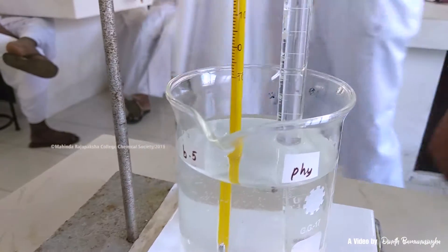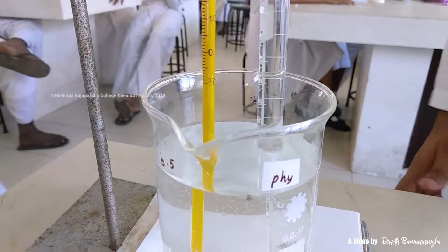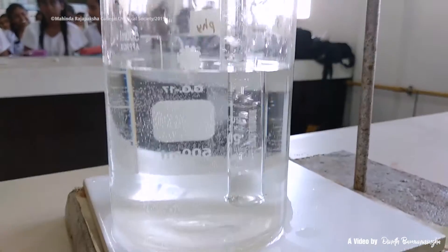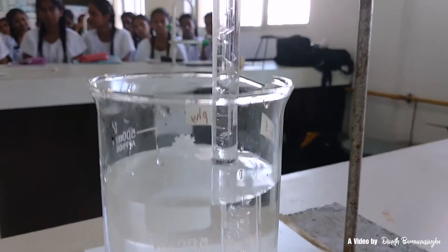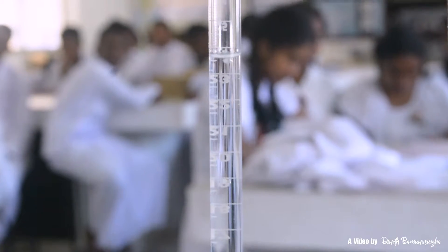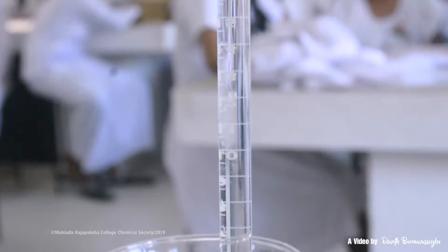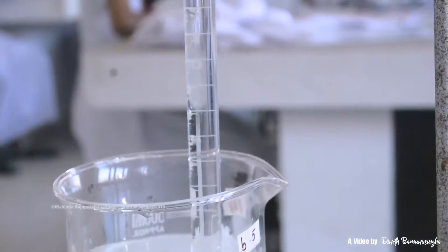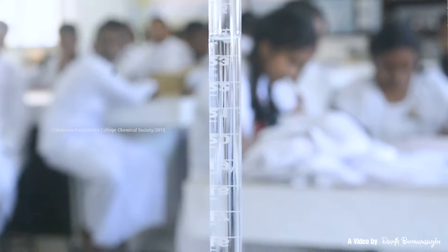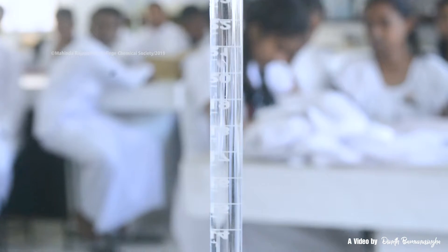Then measure the temperature at which the reaction takes place. The reaction starts with the diffusion of HCl to the metal, and the gas is captured in the inverted cylinder. The experiment is repeated three times in order to get accurate measurements.